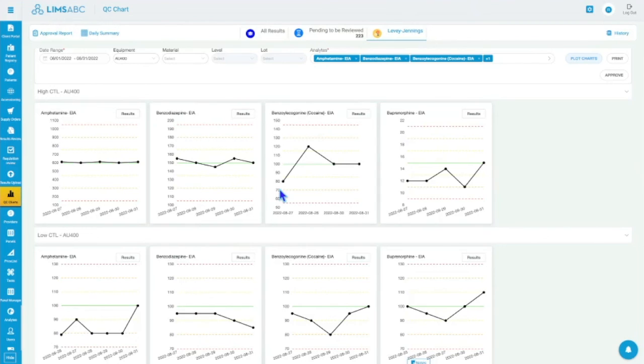But you know what I mean? We have all of those rules. Even the 2-3S or whatever it's called, when it jumps from below minus 2 standard deviations to above 2 standard deviations. So you have a big jump in consecutive results that are more than 3 standard deviations. We can flag those as well, right?